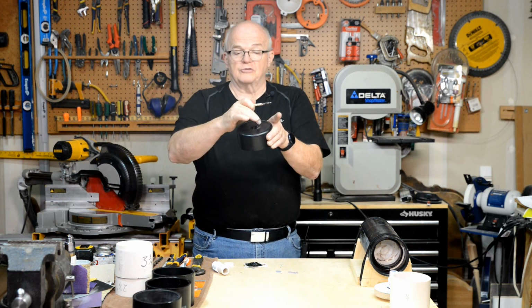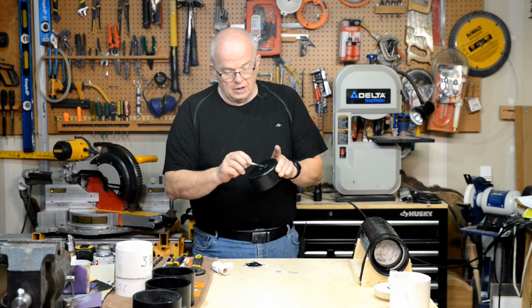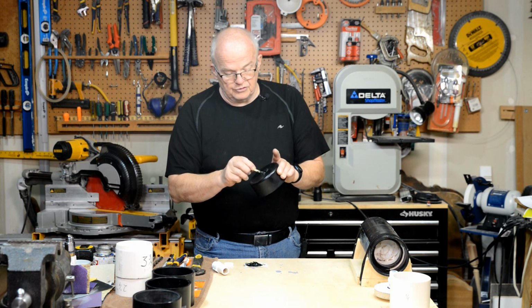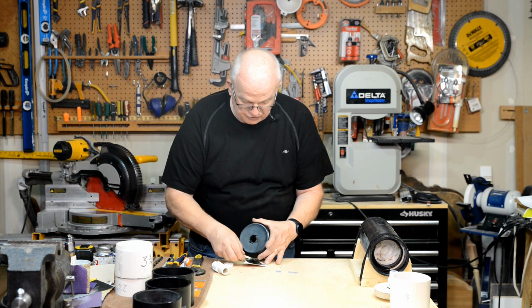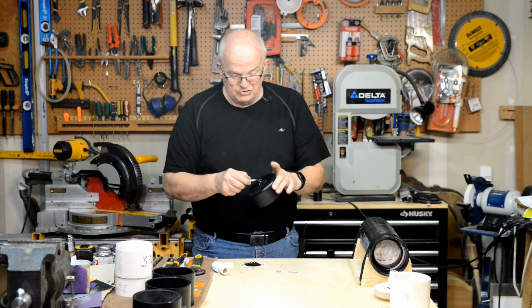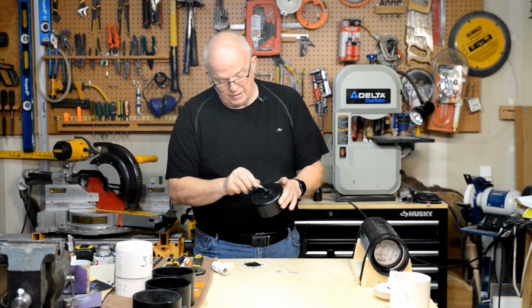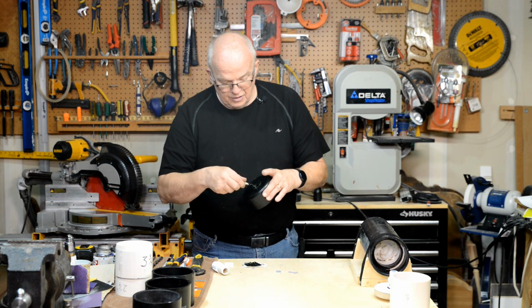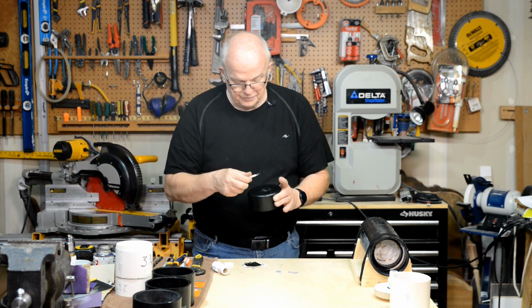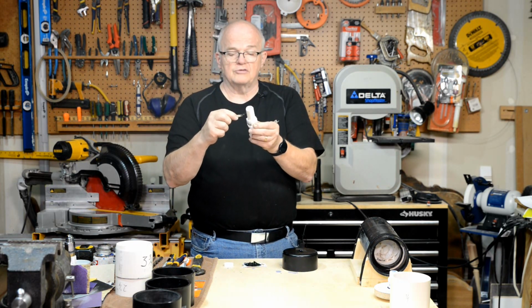Okay, again, and like before, we're going to build up around this outside on the top, just maybe 1/8 of an inch back around the top, so that when that PVC pipe fits in there, it's going to seat itself down into a nice thick bed of epoxy that will, in fact, form the seal. Be generous with it. Don't be afraid that you're going to use too much, because you're really not. All right, now that I've got enough built up on there that I know that I'm going to get squeeze out when I put this into it, again, I'm going to put a little bit around this outside edge here.